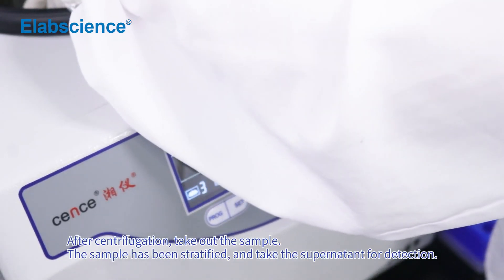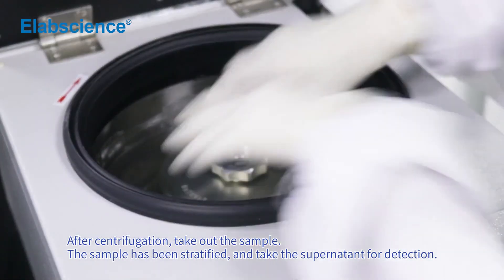After centrifugation, take out the sample. The sample has been stratified, and take the supernatant for detection.